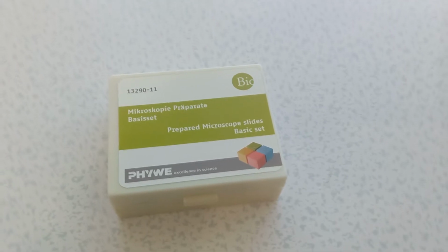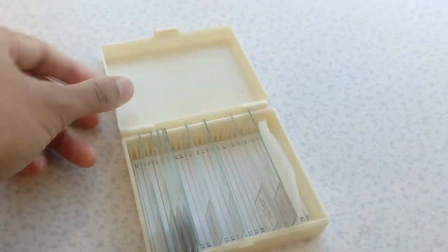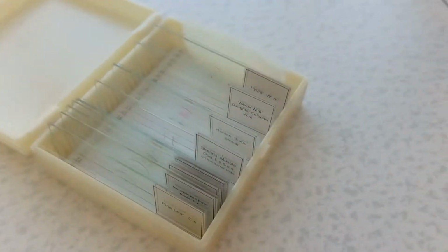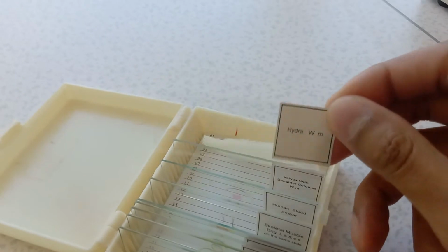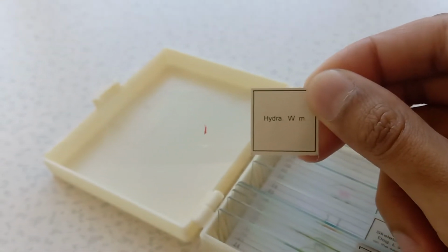I'm actually in school right now. It's completely empty because of coronavirus, but I'm going to show you how to use a microscope in case you were asleep in class. Now, obviously, if you're going to use a microscope, you need two things. You need some slides, and we've got some here. I'm going to use maybe this thing here. It's called a Hydra. It's got a nice big bit in the middle for me to have a look at.